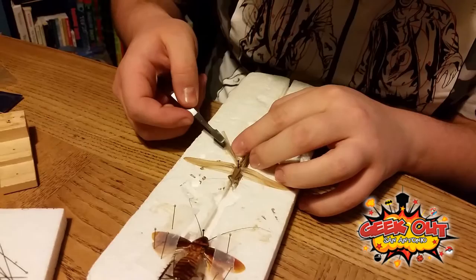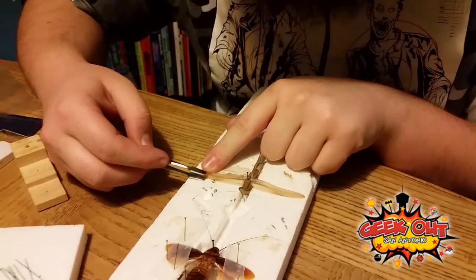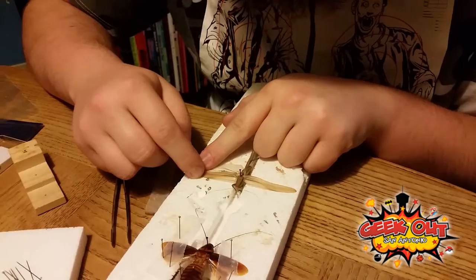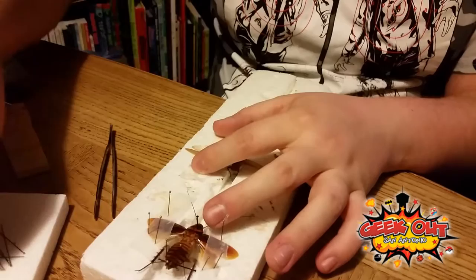As I'm showing you, they're not easy to pull out — it takes more work with the grasshopper. They're so light and feathery. You have to be very, very careful with them. And then again, pinning the wings is your preference. You can pin them straight or more up, or you can do just one side or both sides. So there's lots of different things you can do with them. I've seen some that you do just one.